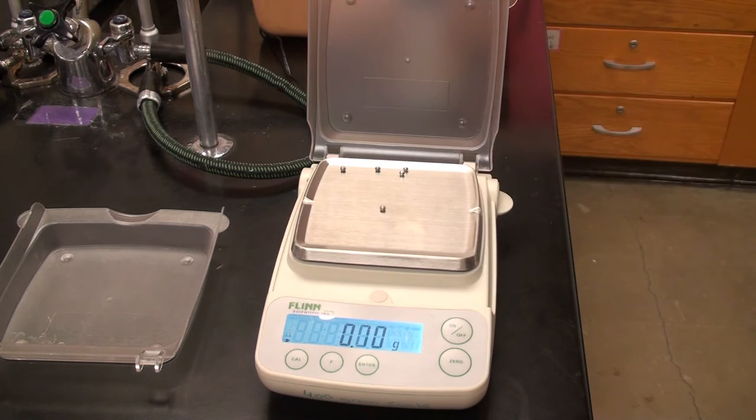These seem a little less consistent. It seems like it doesn't stabilize as well as some of the other ones. The numbers are pretty close, but they're not stabilizing as well, and I think that's because the ventilation system is on right now. I think our vents are blowing air around this classroom. I can feel a faint breeze from it, and I think that's what's throwing our balances off.